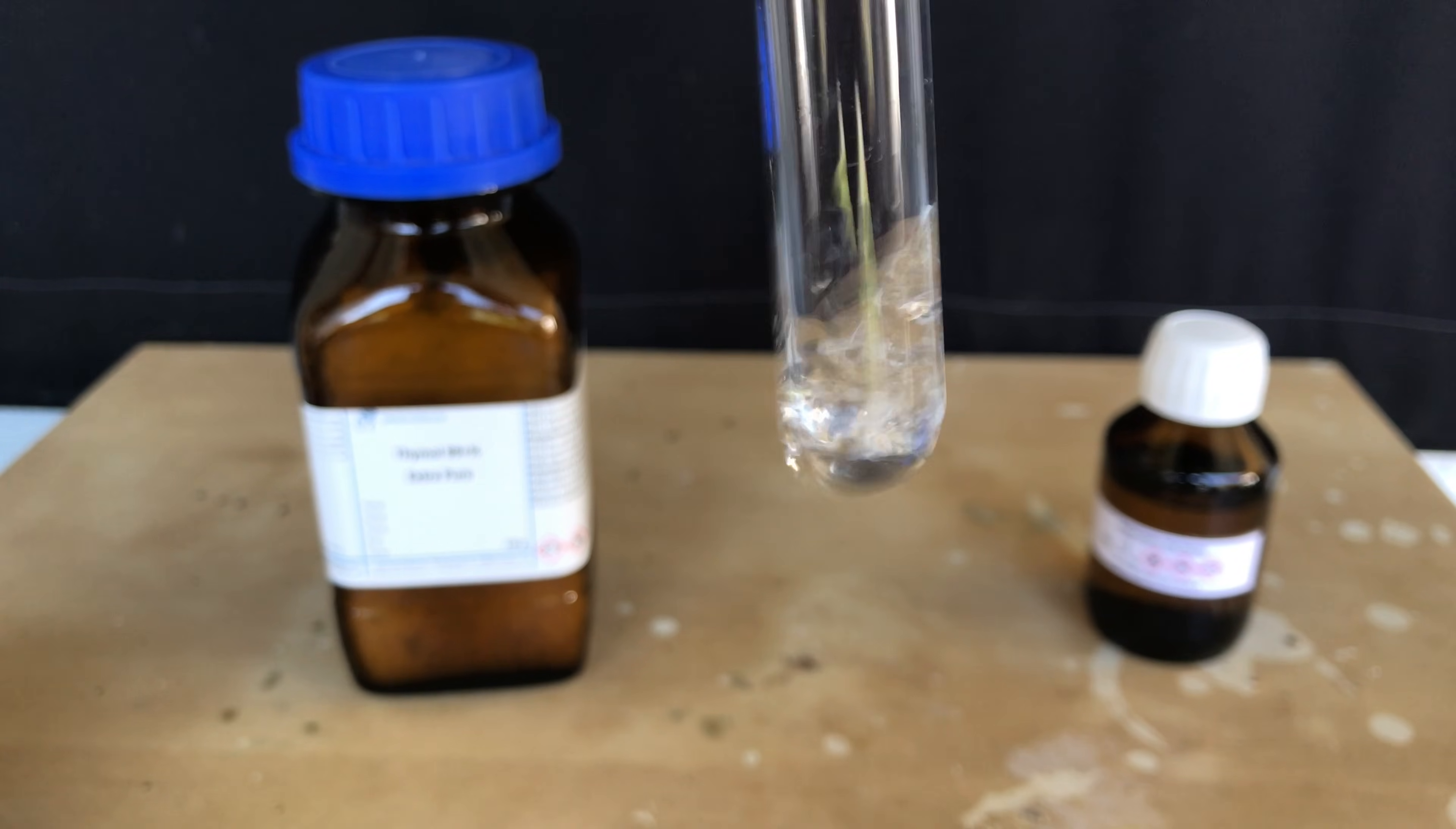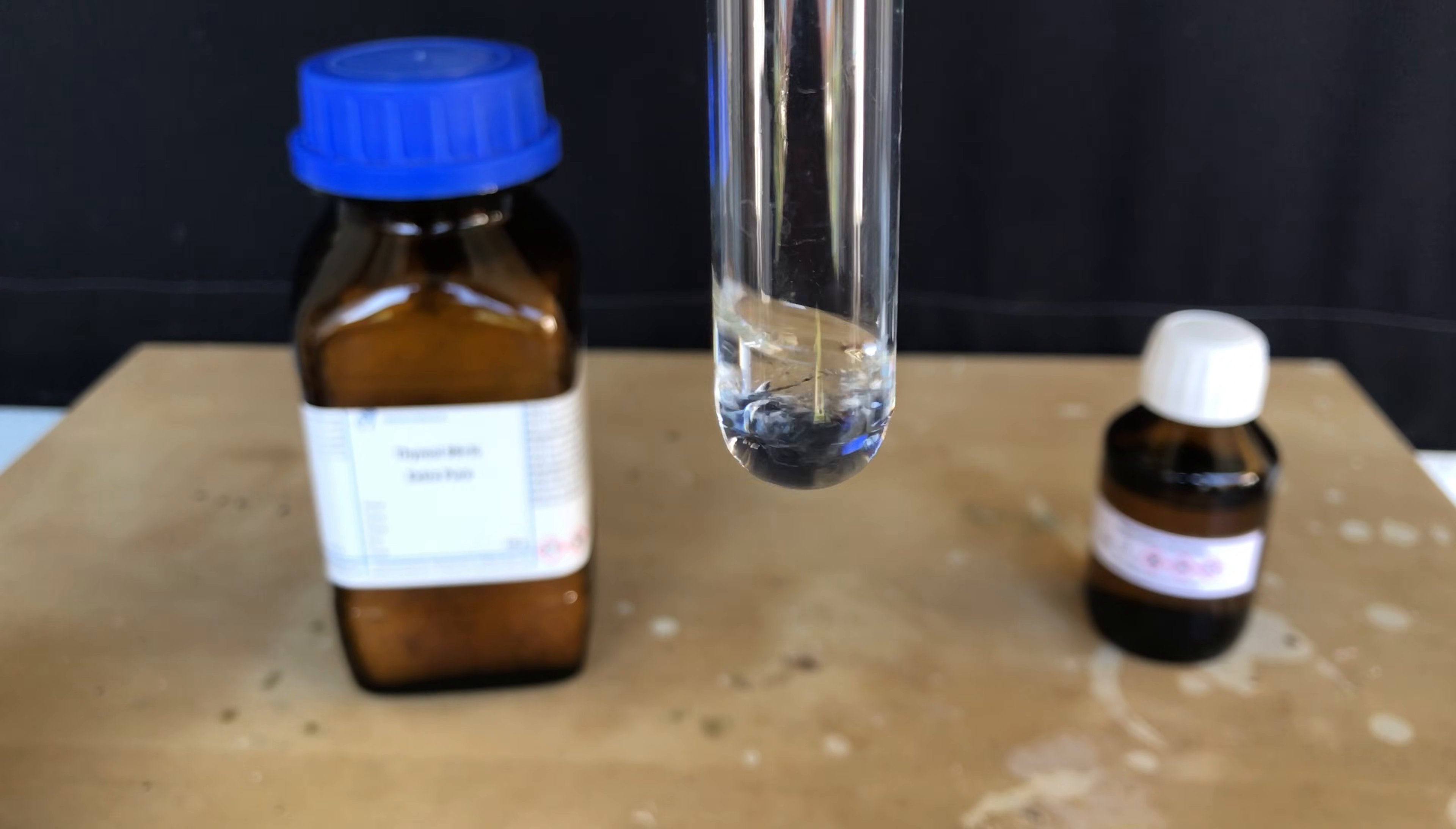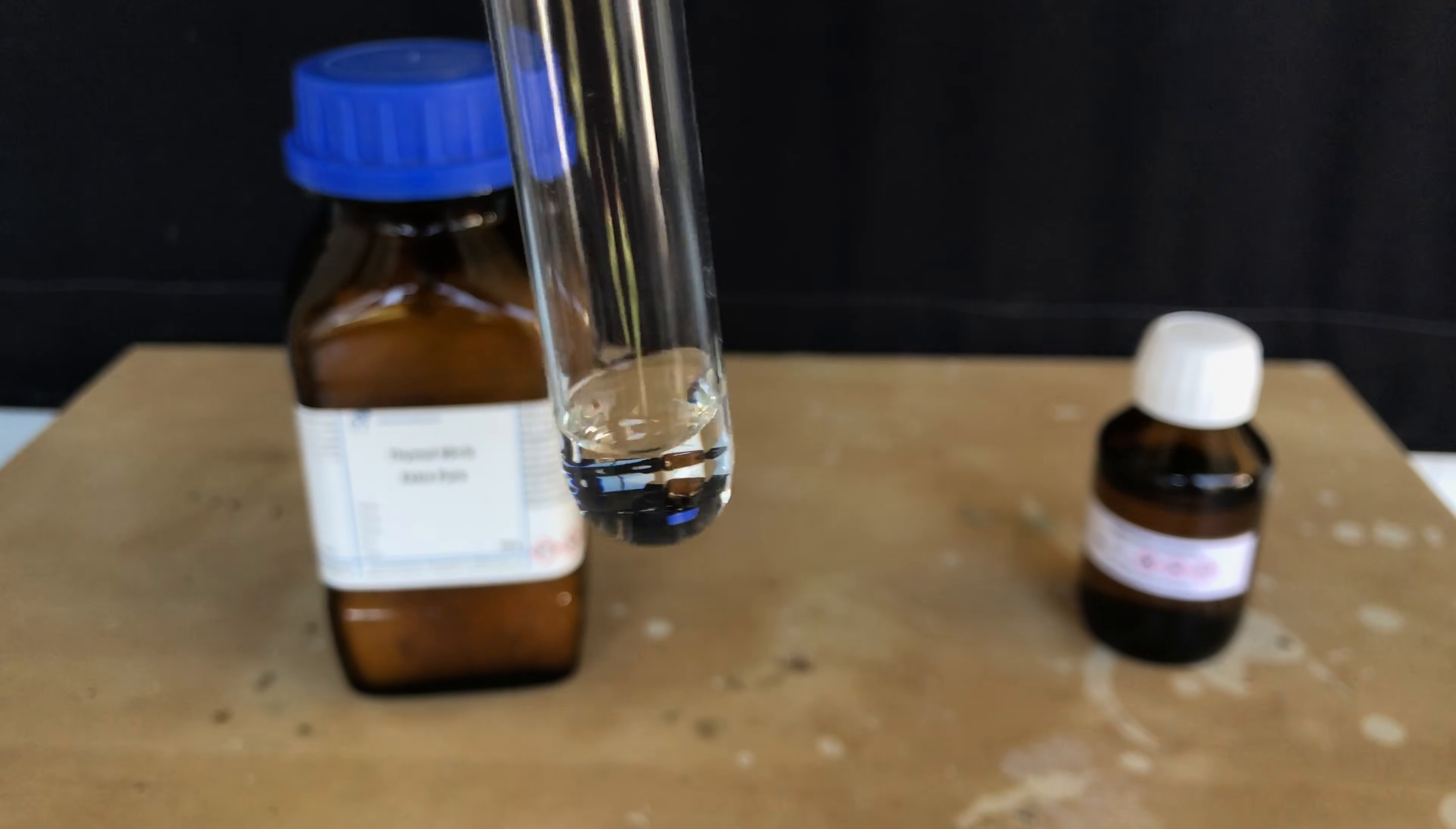This method is very quick. In this case our alcohol was thymol and I added the propionyl chloride to it and shook it. I had to heat it up with a lighter for about 30 seconds, but after that the reaction was finished.